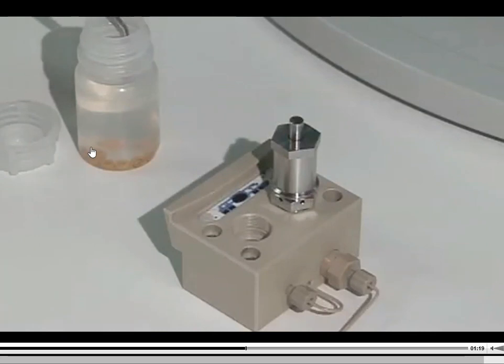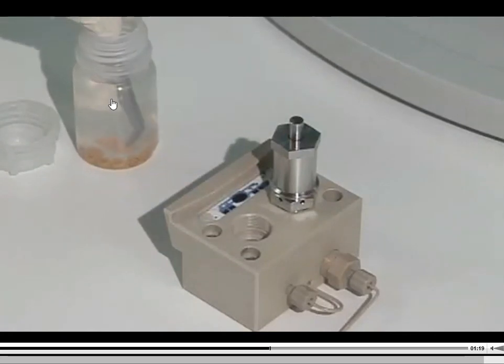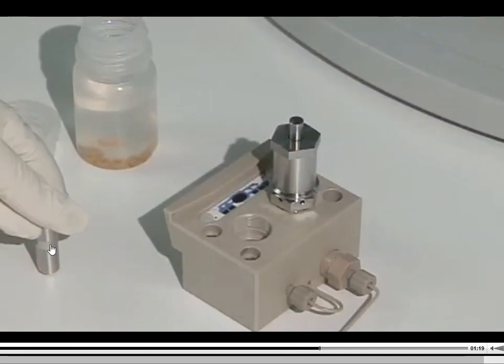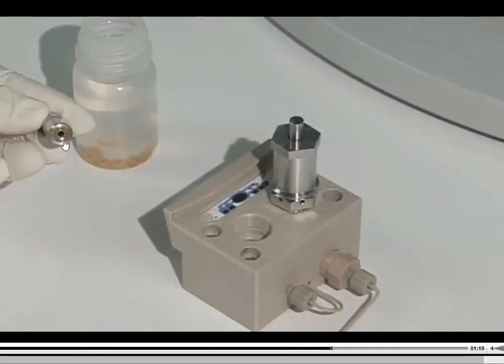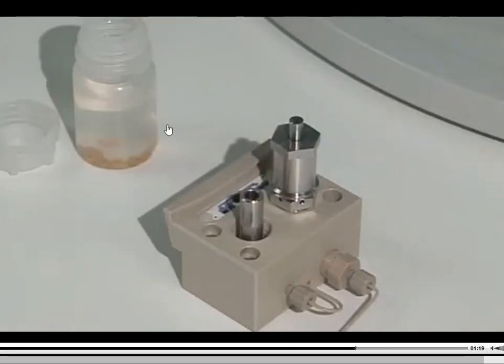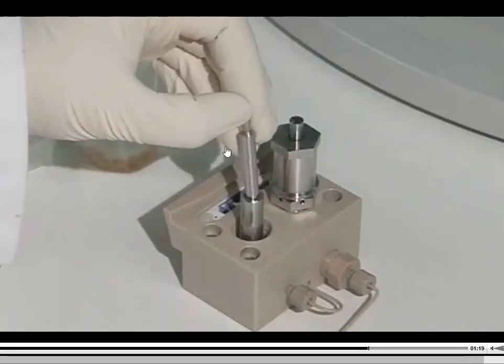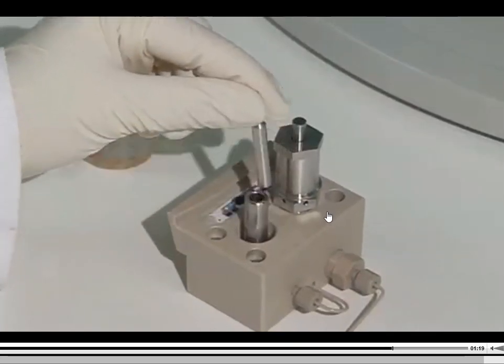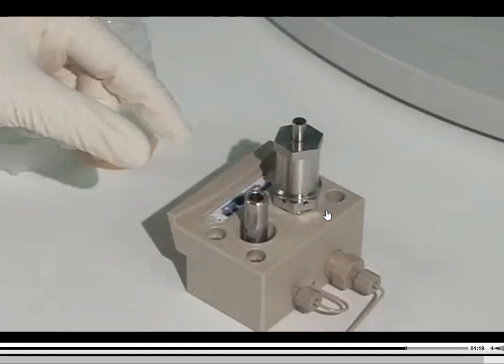So now this person's going to have this jar back here in the back. These seals are probably stored in some kind of alcohol just to keep them clean. There they are. And now there's an extra little tool in the kit that you just pop that seal back onto the bottom, and that gets guided back into the pump. And that same tool that you use to screw that thing out of there with basically pops that new seal back into place, and that's all that you've got to do.